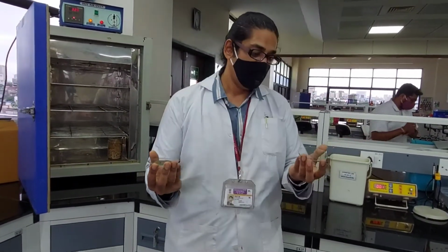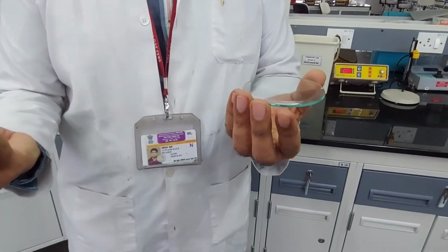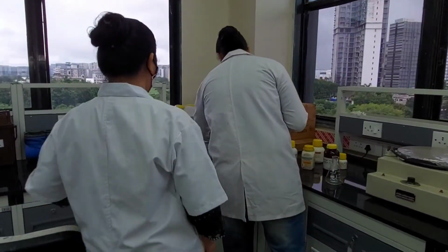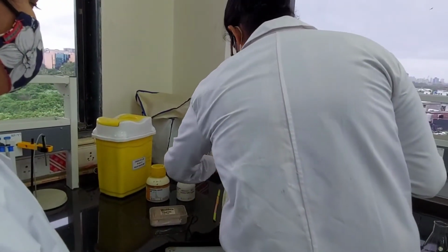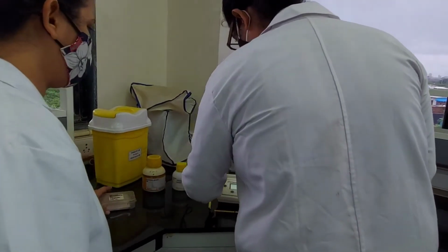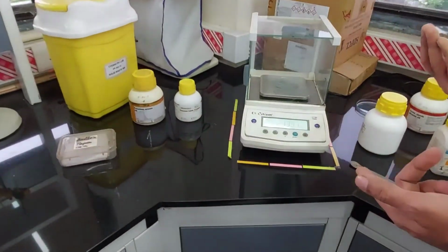You weigh this petri dish on the balance and make a note of it.